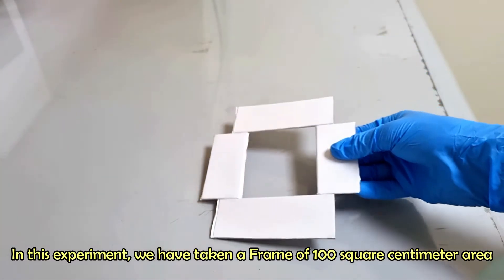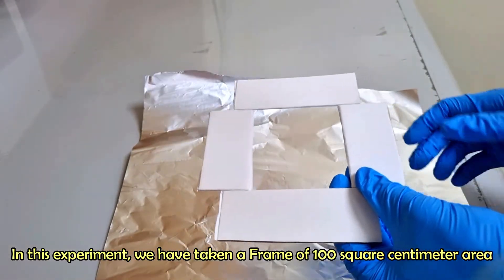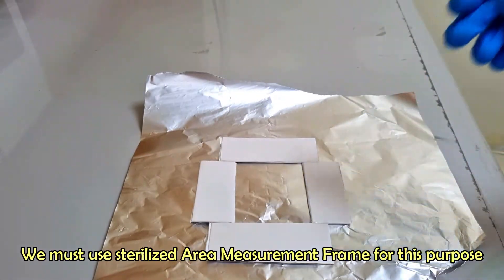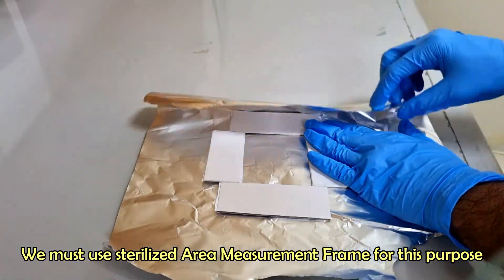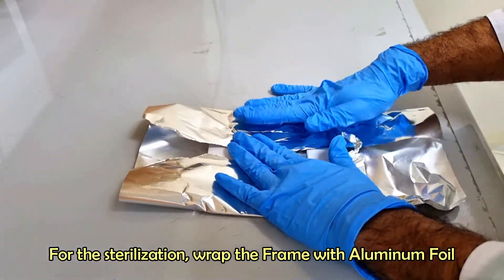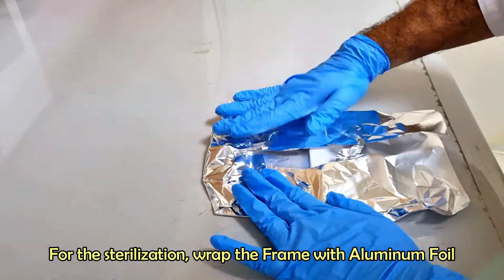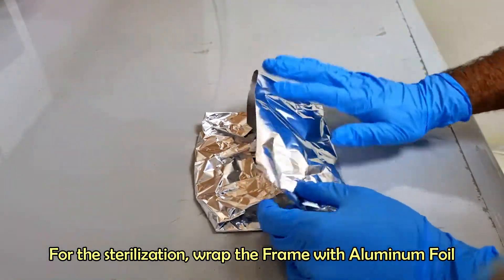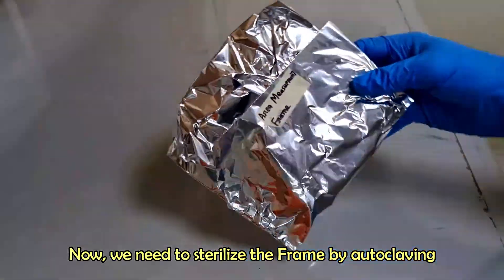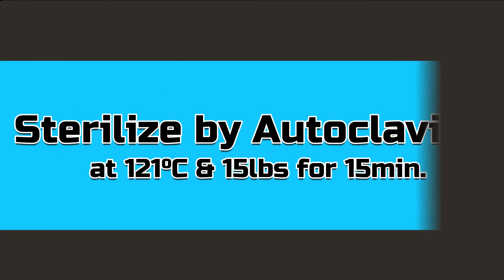Here we used a frame of 100 square centimeters, but you can use a frame of different area. Wrap the measurement frame with aluminum foil paper.